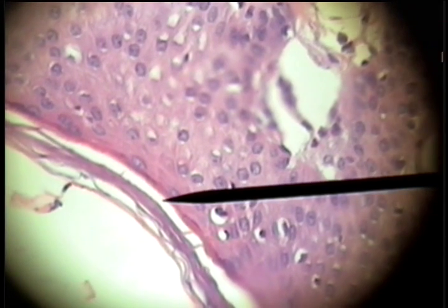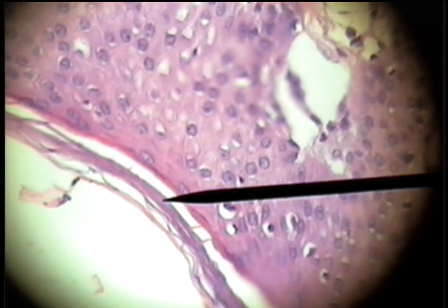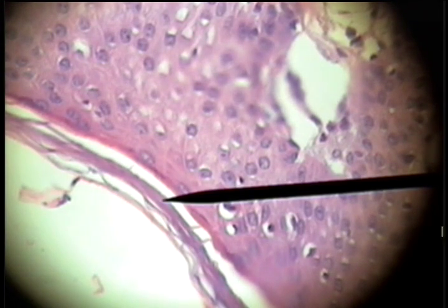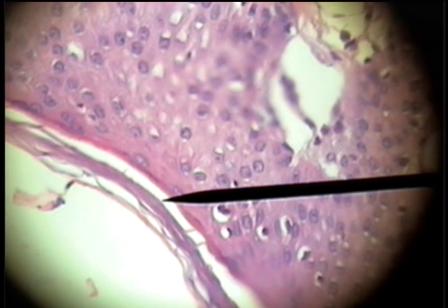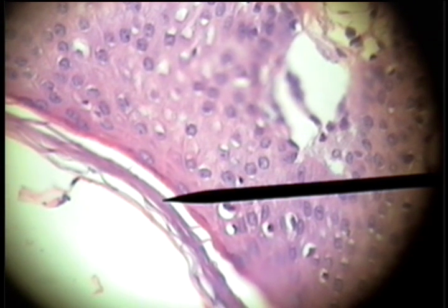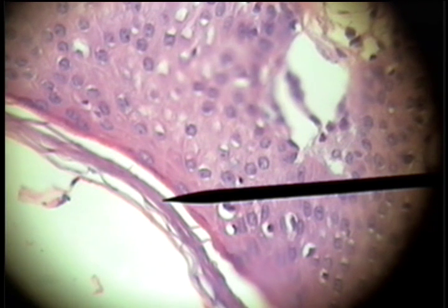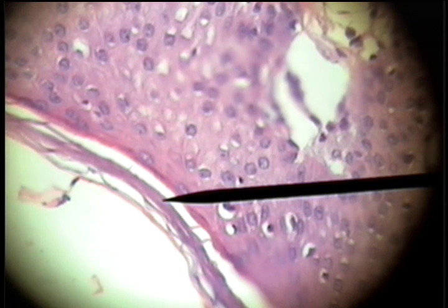The nucleus and the organelles disappear. The protein keratin, non-living scaly material, stays behind, and this would be equivalent to the dandruff associated with thin skin — stratified squamous keratinized epithelium.